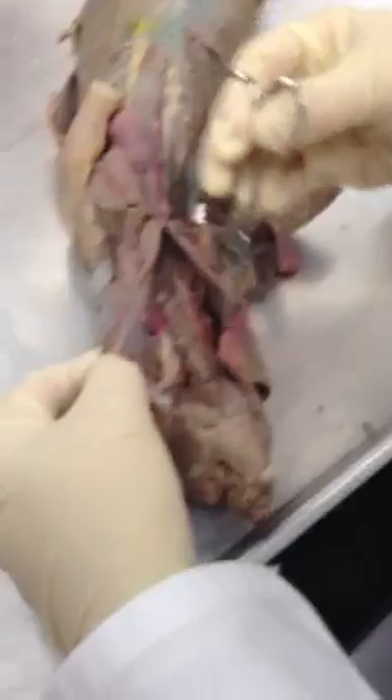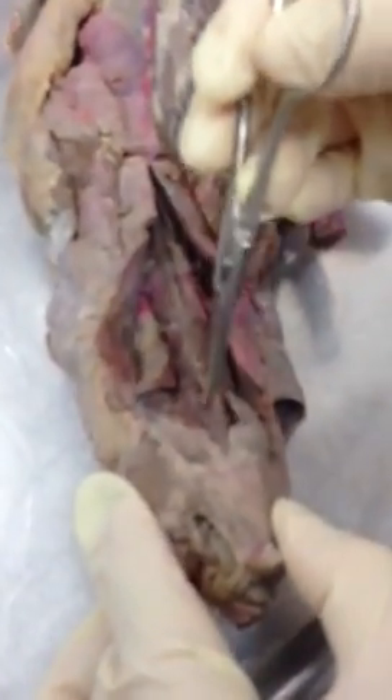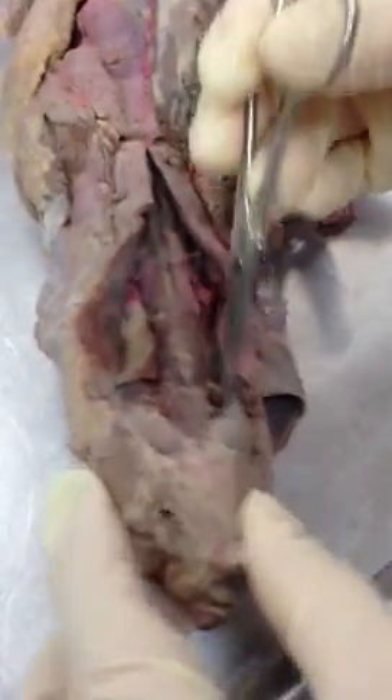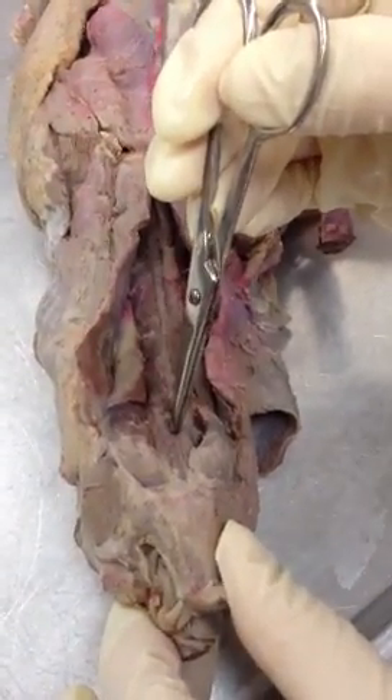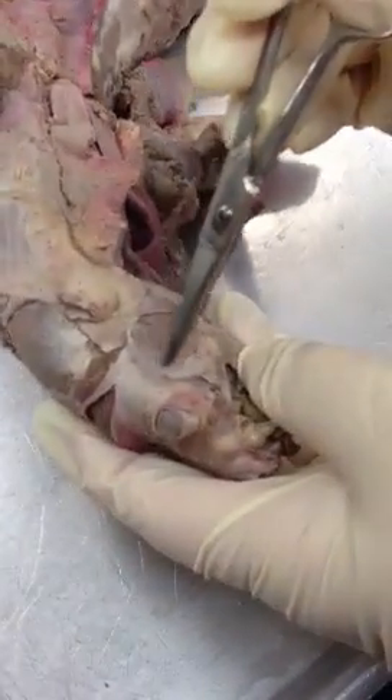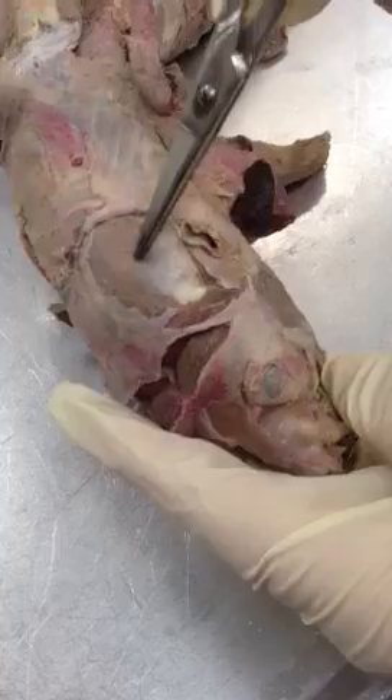So if you open it up now, see the difference? Right in here, you can see a couple different muscles — namely three. So two digastrics in the middle here. This is mylohyoid. On the side right here, the big round muscle is masseter. Up on top, this would be temporalis.